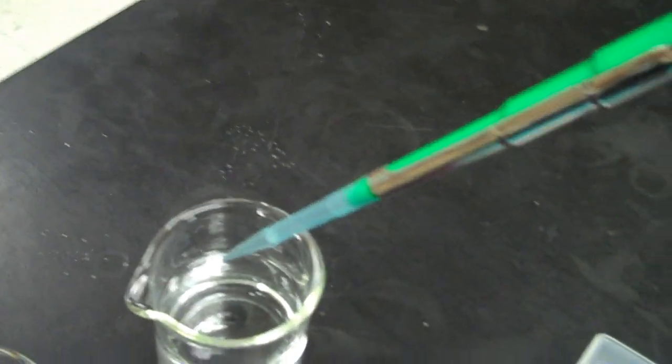Now to eject the liquid, hold it over whatever you're ejecting into and push the plunger down again.